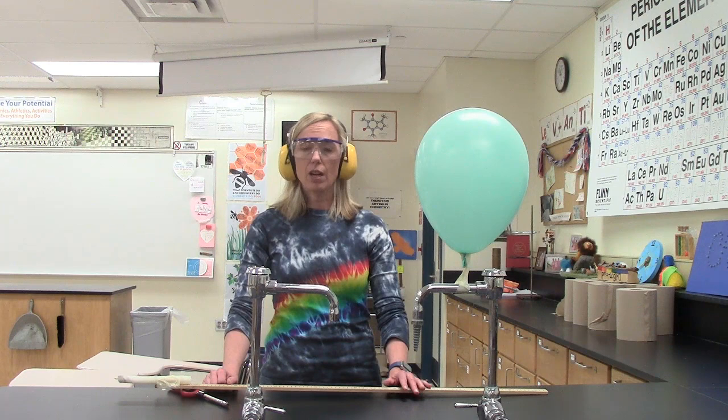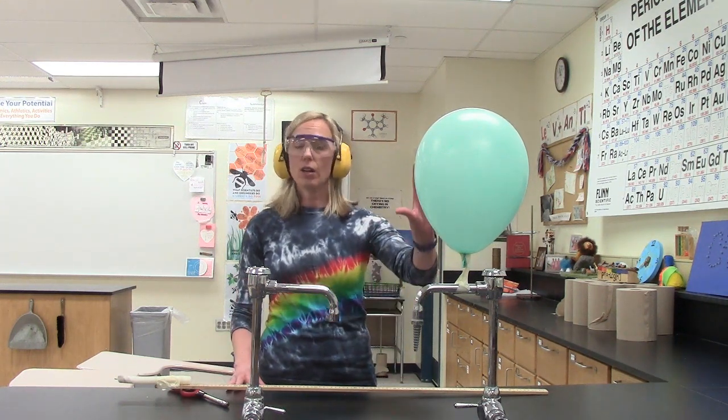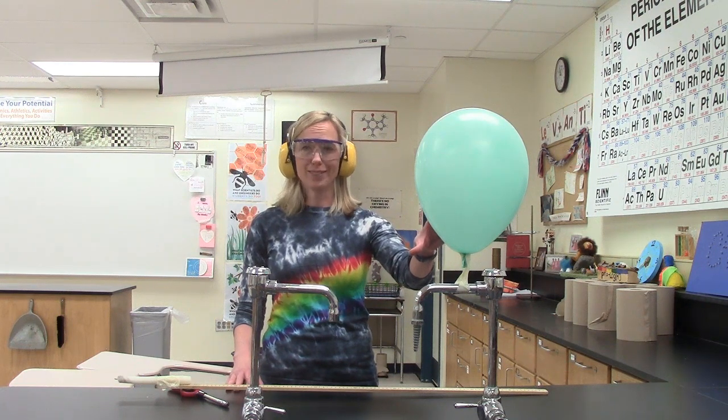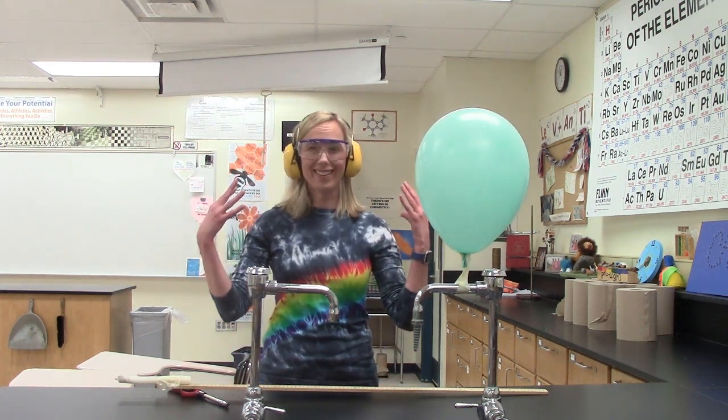So in a moment, I'm about to turn off the lights, I'm going to light the candle, and we're going to get the chemical reaction going. Is everybody ready? Put your ear protection on.